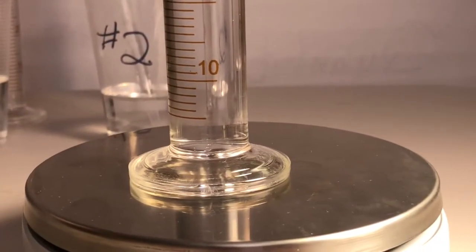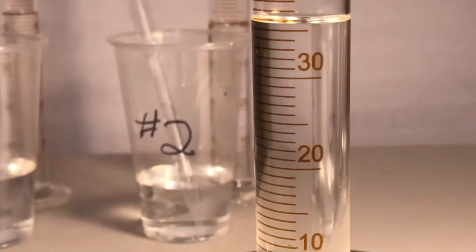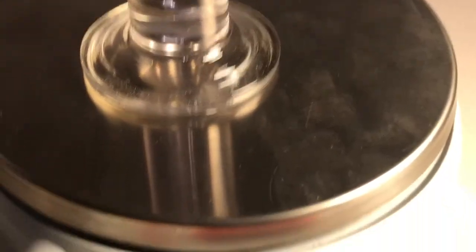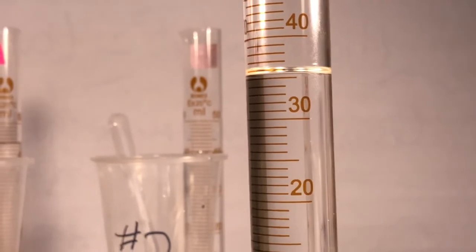Here comes 7. What do you got? Bottom of the white clear crystal line. That's pretty with the light on it. I had my big old head making shadows, so I had to put a nice light on there. Got that? That was 7. Here it comes. Last data point.